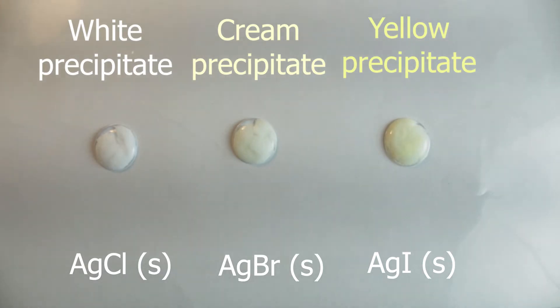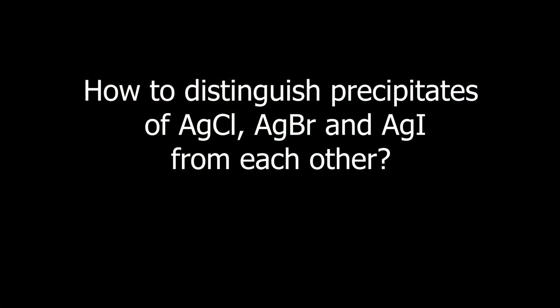But the colors look pretty close to each other. How to distinguish them for sure? Well, there is a trick.